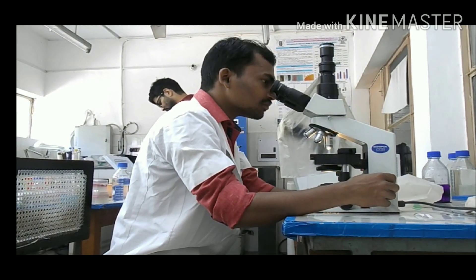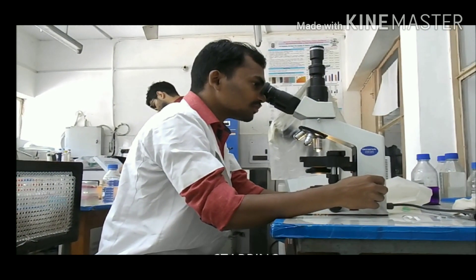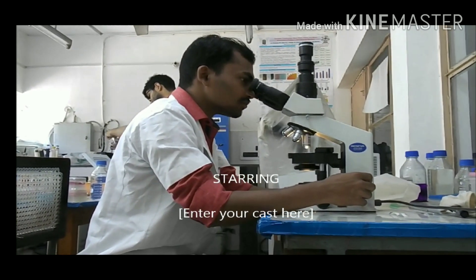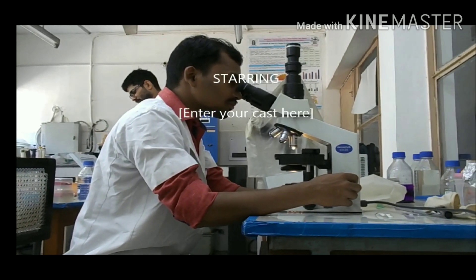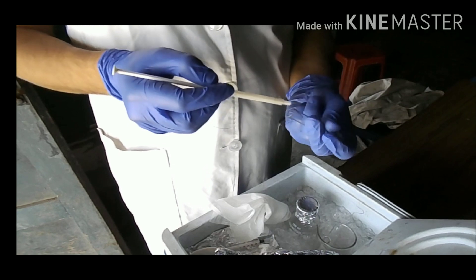After collection, we need to analyze and evaluate the semen. We generally assess the motility of the spermatozoa; live and dead cells are also observed. Based on motility results, we decide whether to proceed with inseminating the hens.